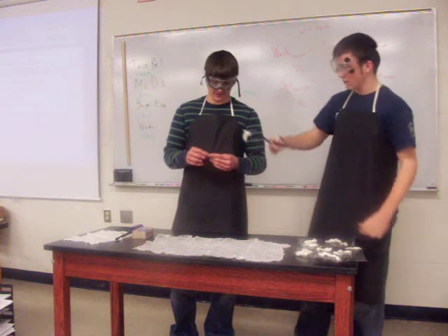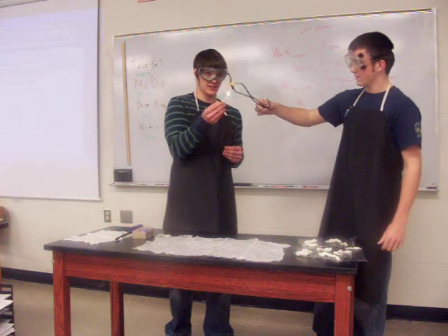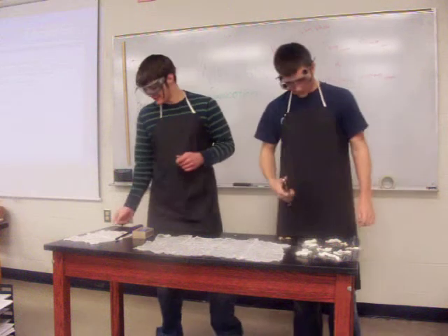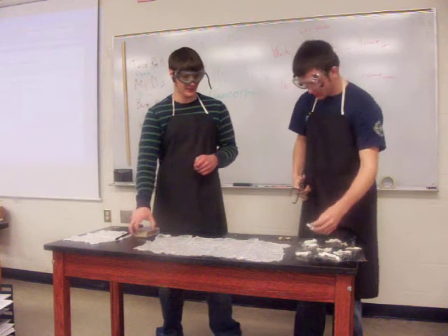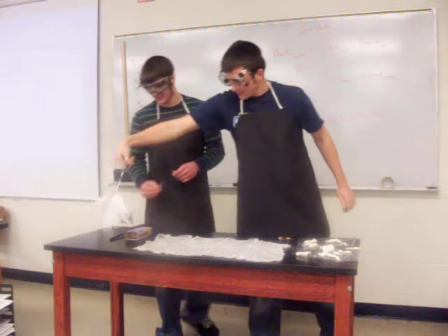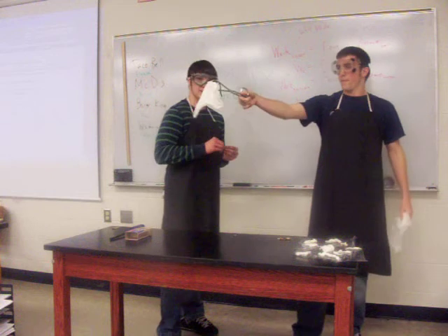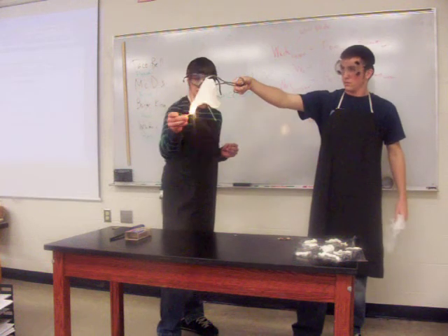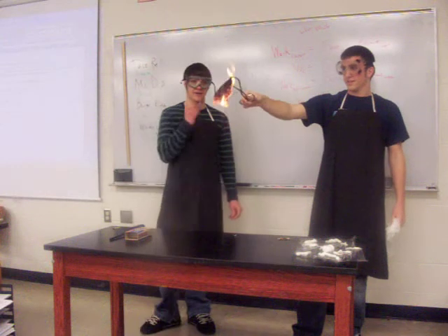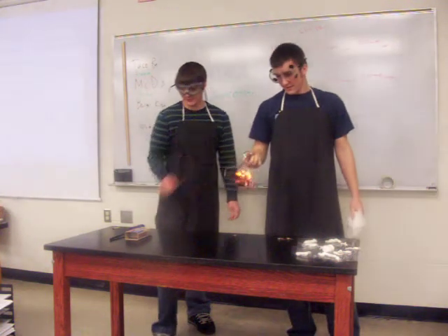That's it. Duds again. They're not liking this, Mr. Solomon. I noticed. I would like it, but I don't have time. That's a real burn. Yeah, but not like it's supposed to.